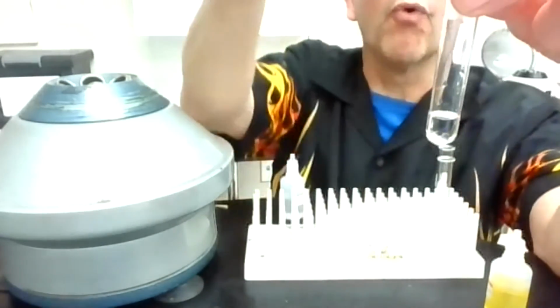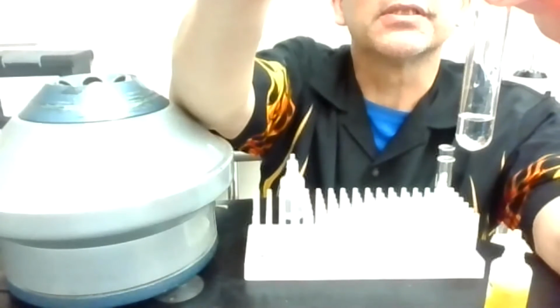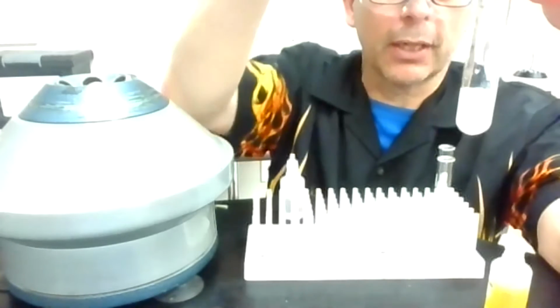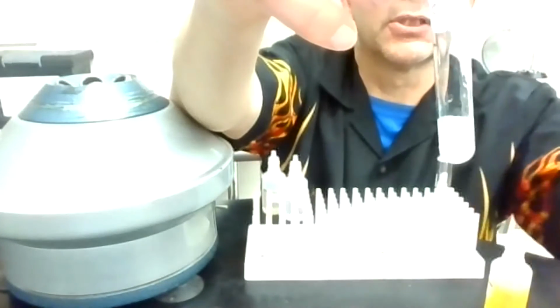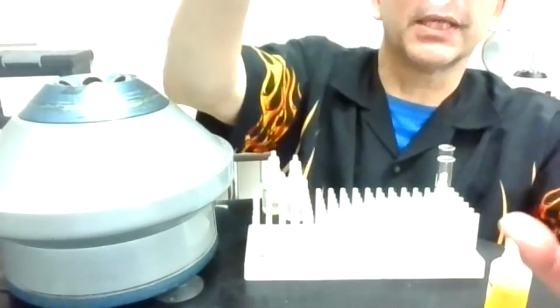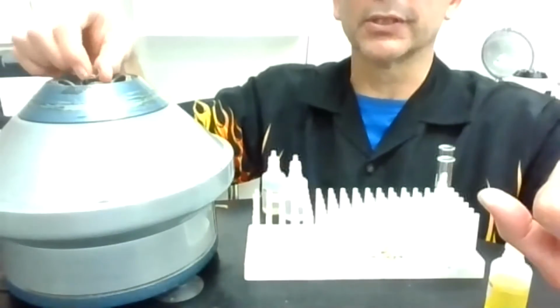So I'm going to go right to my next step and add Fe(CN)6 minus 4. And watch as you add the drops, because this is sometimes where things stand out. I definitely see cloudiness happening as I'm adding those drops. So this is the one I want to mix really good. Hopefully that's going to centrifuge out. Sometimes I have a hard time separating and have to do this a few times.